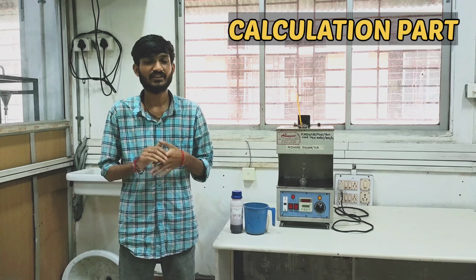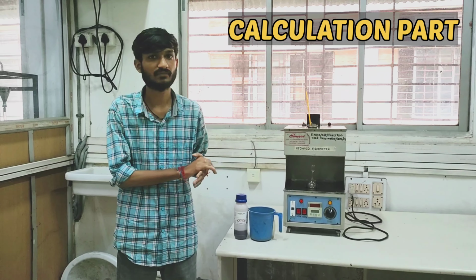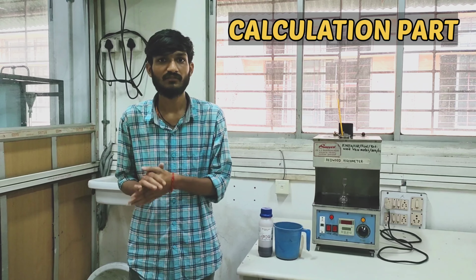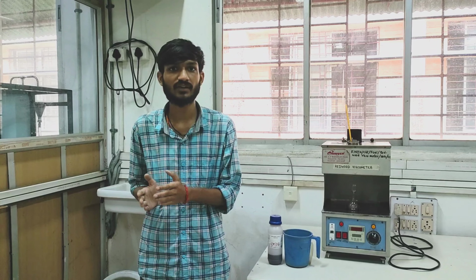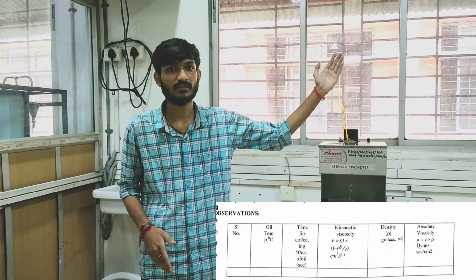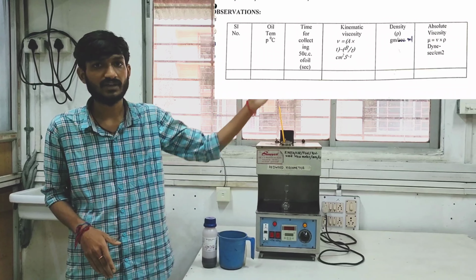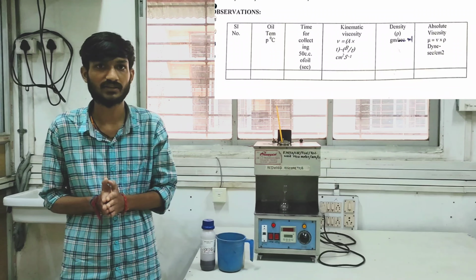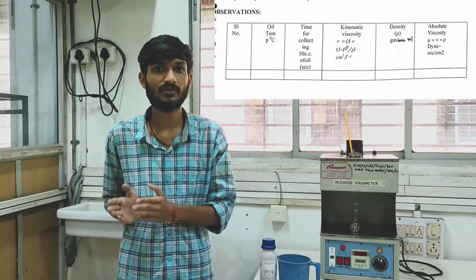We have discussed in this experiment how the viscosity varies with the temperature, the theory and the introduction part. For now, moving ahead with the calculation and the observation table. For the calculation, we have to know the exact value of the viscosity at a particular temperature. For that, we have the observation table here, where we have first the oil temperature, and second the time taken for collecting 50 centimeter cube of the sample in the measuring flask, from which we have calculated the kinematic viscosity and the absolute viscosity.